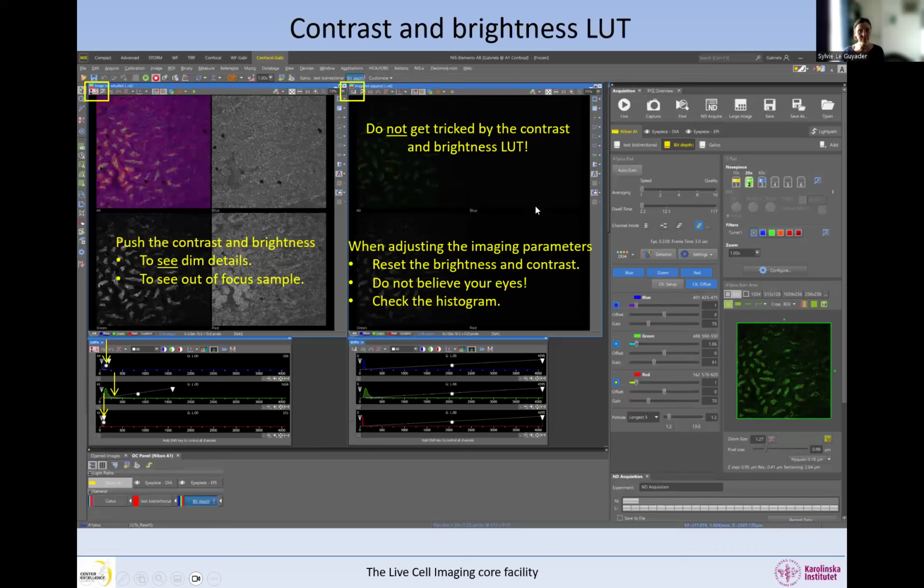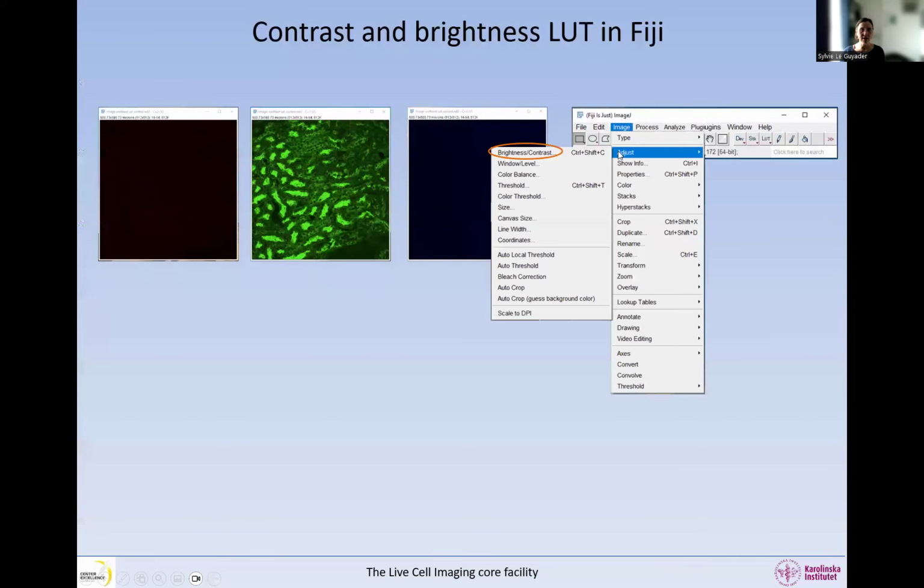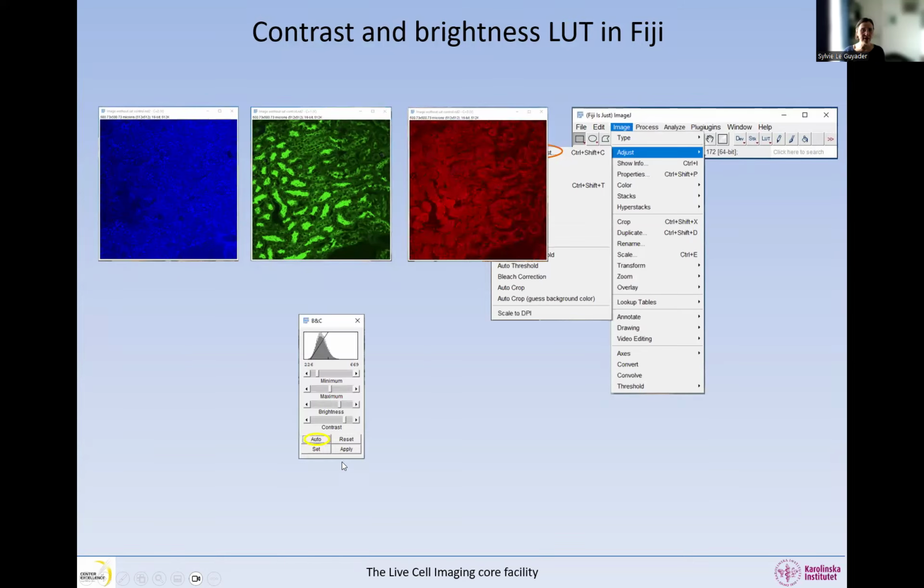Your image is very dim. And do not believe your eyes. Check the histogram and check the numbers. So brightness and contrast in Fiji, we go to Image, Adjust, and Brightness and Contrast, and we get this dialog in here, and we can click on Auto, and this is what happens.